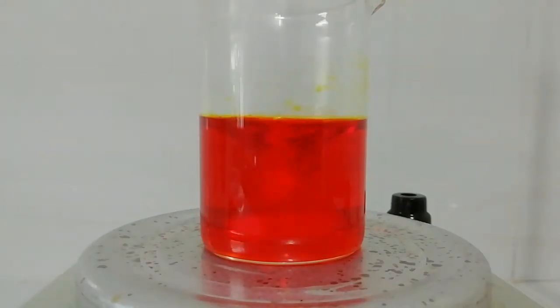After adding sulfuric acid, the temperature of the solution has increased. Now we need to keep the solution until it reaches room temperature.